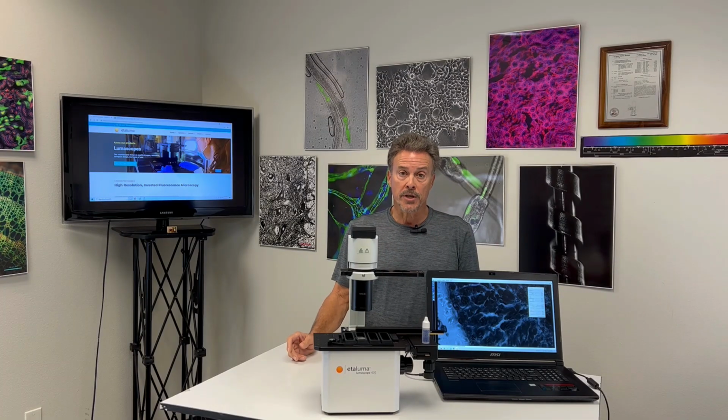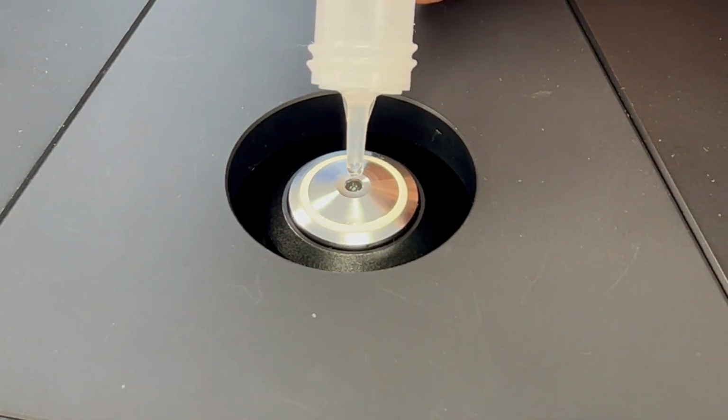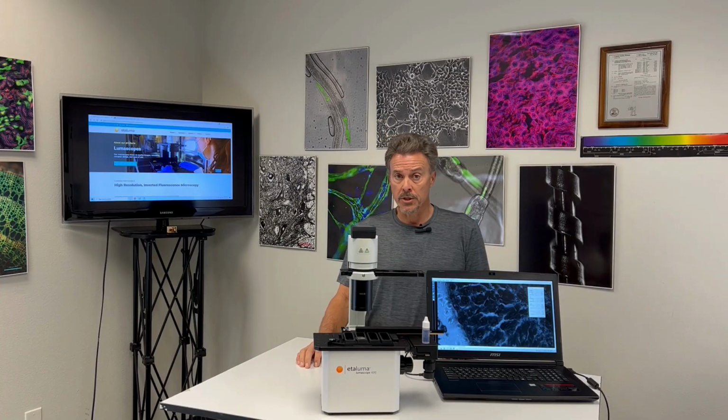I wanted to demonstrate the use of oil objectives on our microscopes. For upright, you would put the oil on the sample. For inverted, we put the oil on the objective. You can see how the oil couples to the cover slip as we bring the objective into focus.